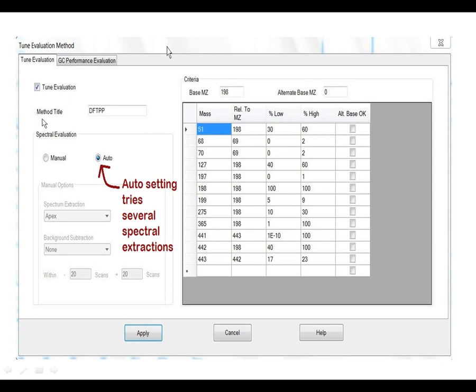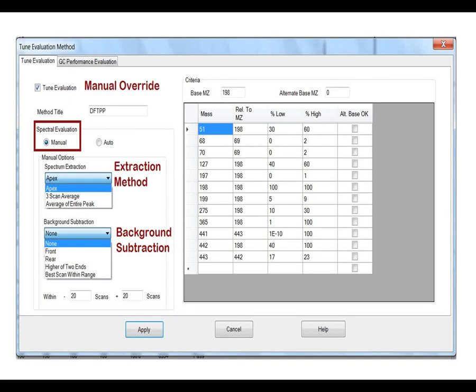And over here, you have the ability to invoke an auto settings, which tries several spectral extractions. The auto settings will try all of these in combination to look for a passing criteria. If you want to override that, you can do the manual spectral evaluation, and that you get to choose from these three in terms of where in the peak you're going to pull that particular spectrum and how you're going to deal with it in terms of subtracting the background, either from the front, rear, higher of the two ends, or best scan within. You can dictate that manually.